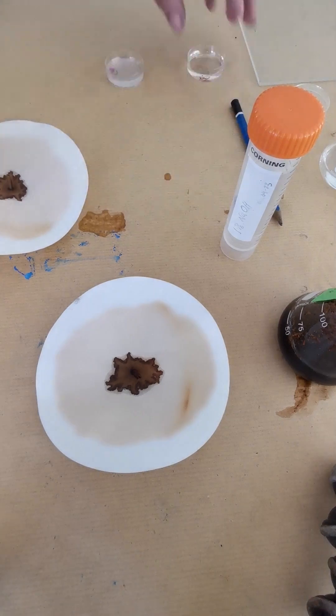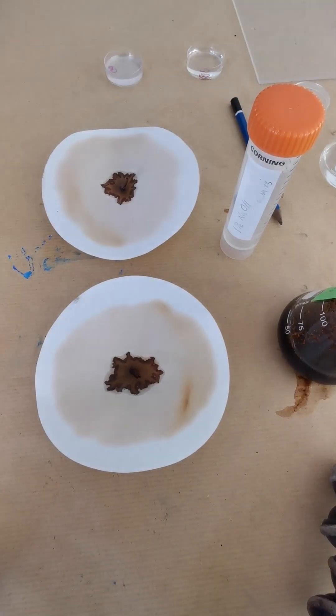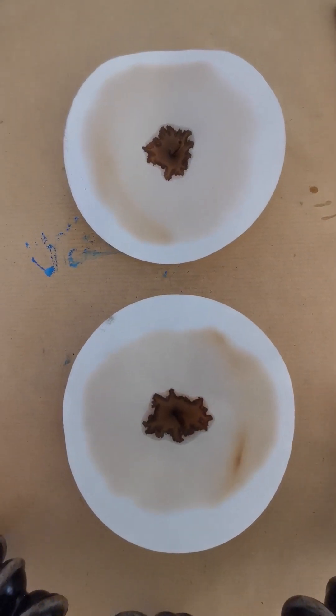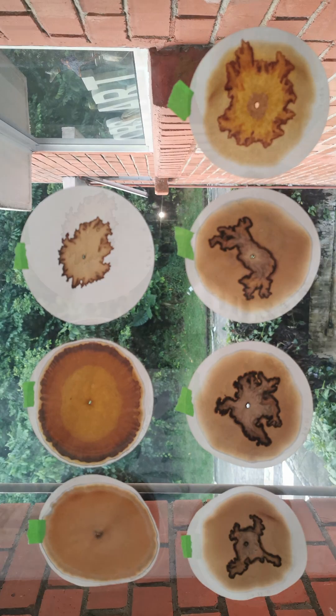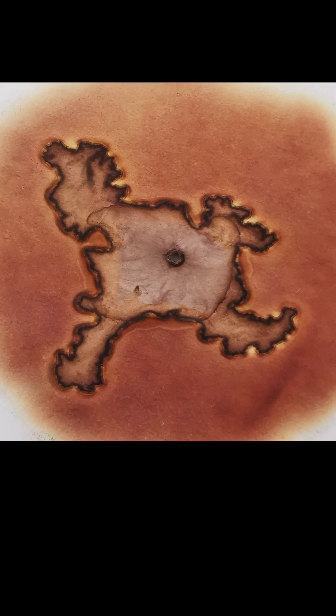It will take a while. Best is done in the dark with hot water to keep the humidity under a box. After drying in the dark, you can expose them to indirect sunlight for a week to reveal the full color.